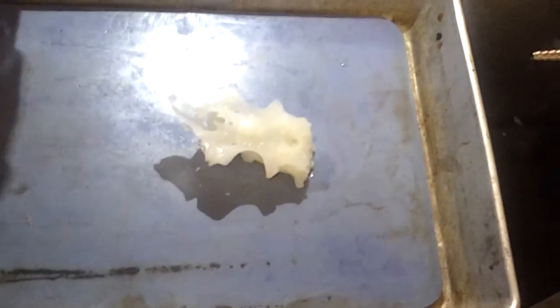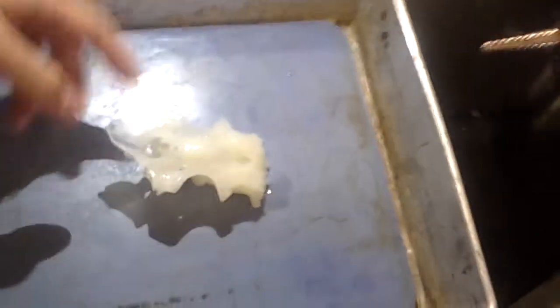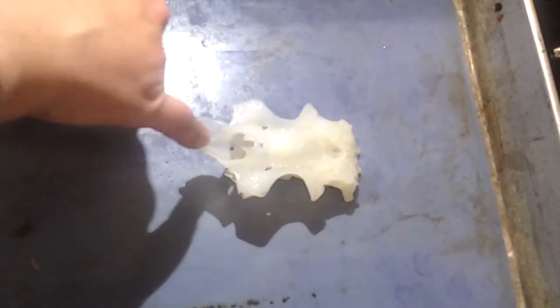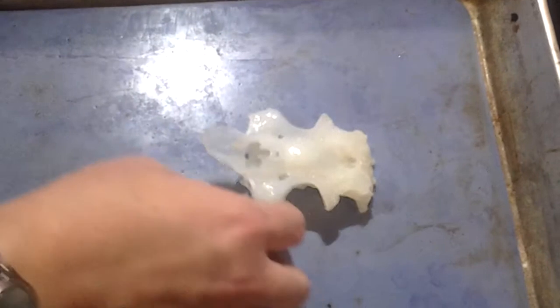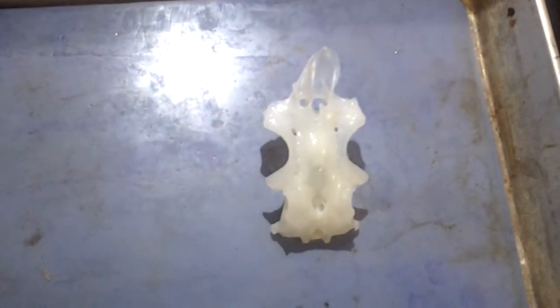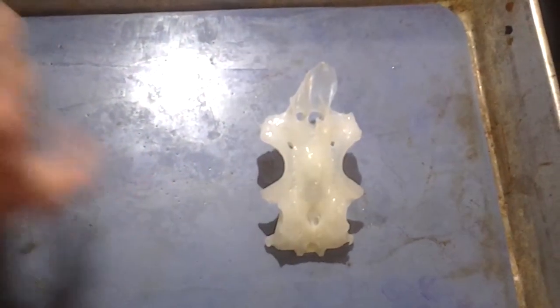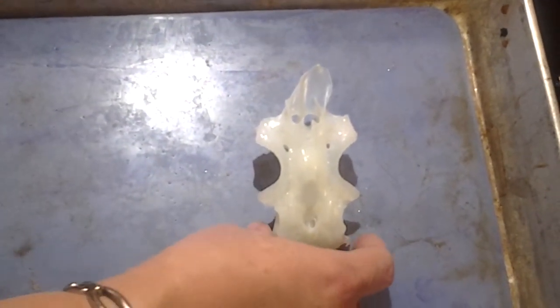The chondrocranium. Okay, so let me quiz you all. What's this? Precerebral cavity. Right, precerebral cavity, and what's this thing here? Rostrum. Rostrum, good. What's this? Otic capsule. These are the otic capsules. What's this hole here? Endolymphatic fossa. Yeah, endolymphatic fossa, right.